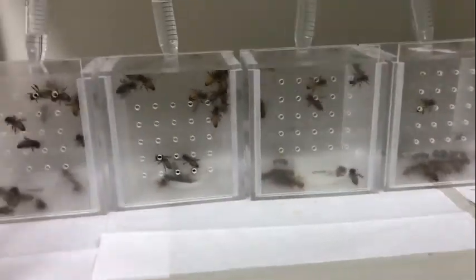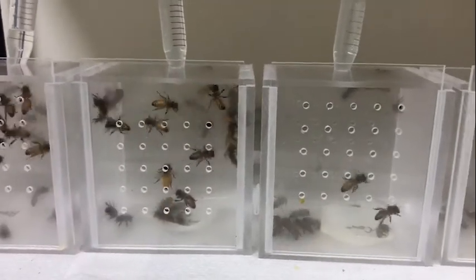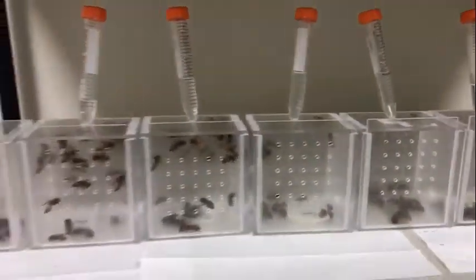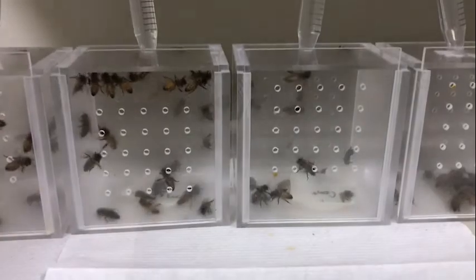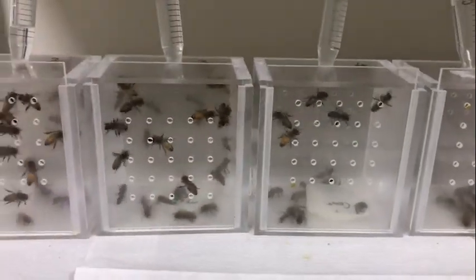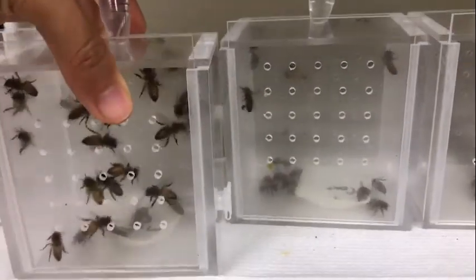And so we can use this tool to manipulate the diet, or introduce different treatments during larval development. You can see the cages already have feeders inserted in the top hole. Like I said, we start out with this little blob of food during the inoculation stage, and the feeders would not have been inserted yet. Instead, after about 1 or 2 days, the feeders include food.